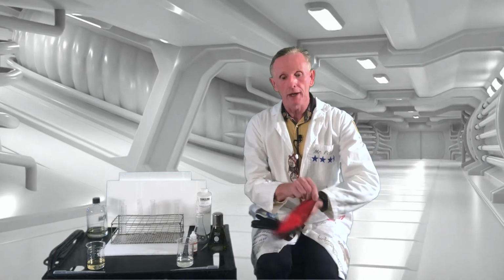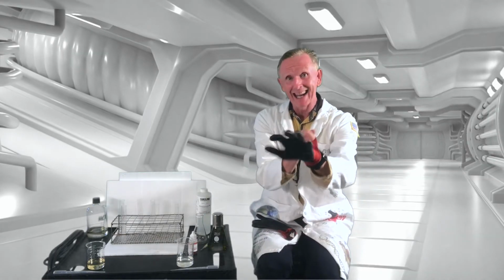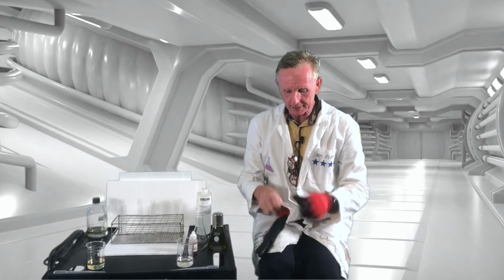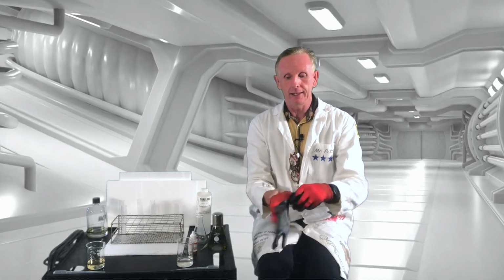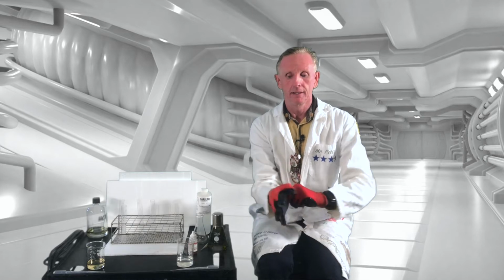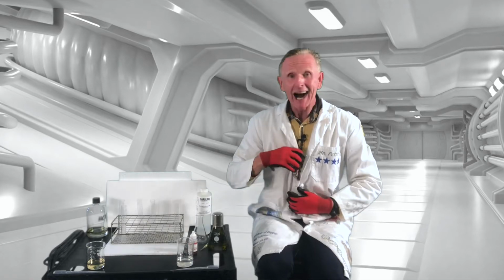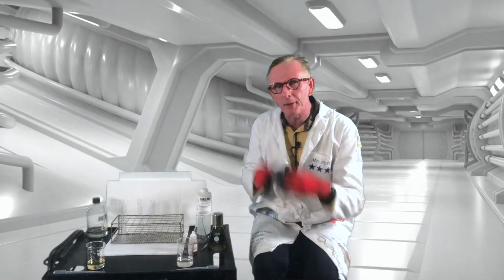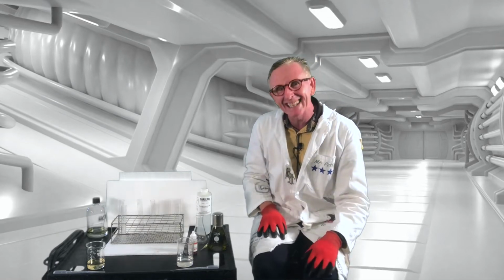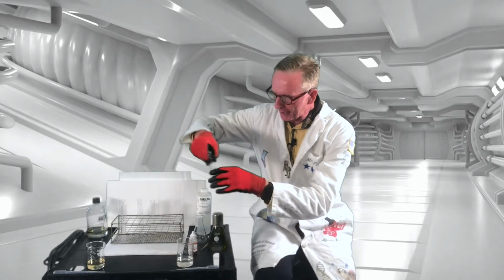All right, now I have some proper hand protection and proper eye protection. I'm not too worried about vapors, but there is the possibility of something splashing, so I don't want it to get into my eyes. Well, let's take a look.